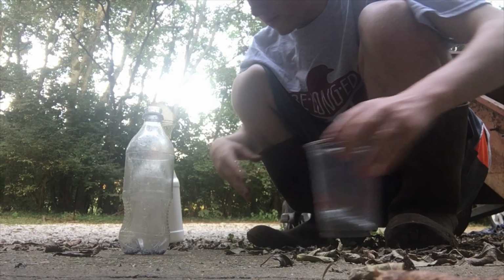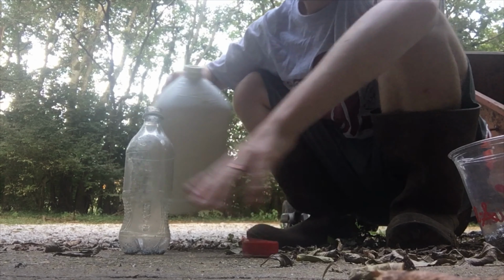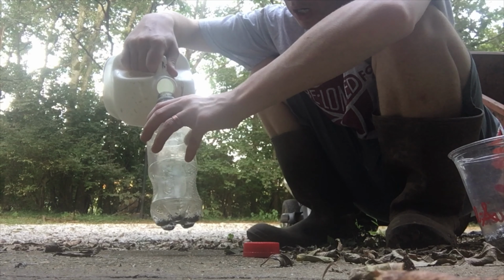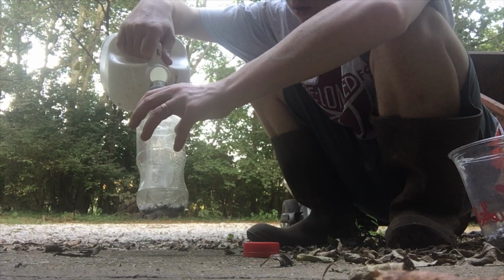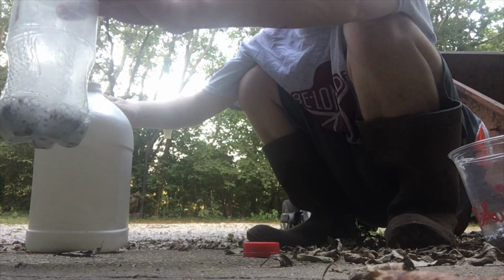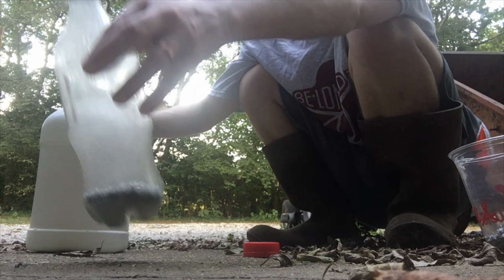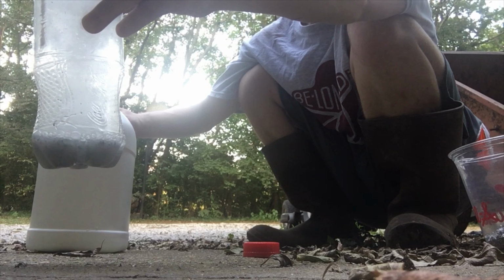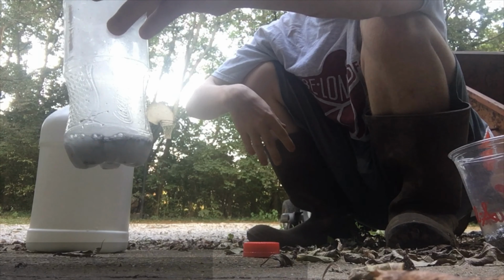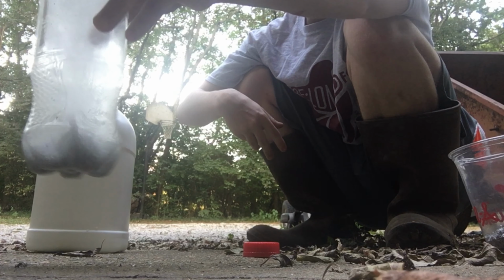Right then. And so this is the muriatic acid we've used. And so here we go. Let's just pour. That is hydrogen gas. Now that's what I wanted to happen, and look how quickly that goes.